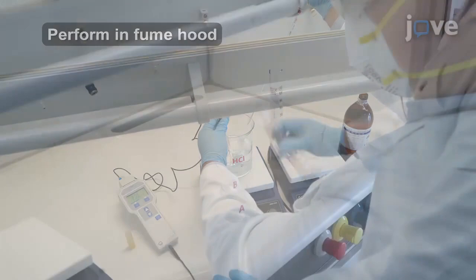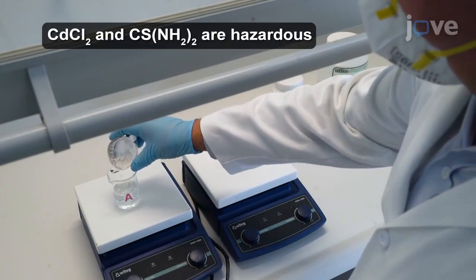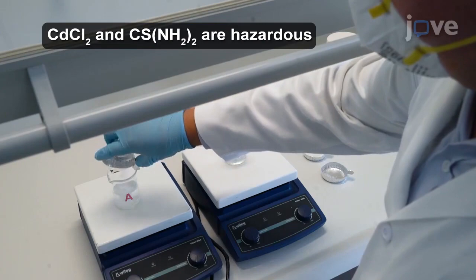Next, pour 50 ml of the precursor solution into two 100 ml beakers labeled A and B. Add 2.29 g of cadmium chloride and 1.33 g of thiourea in each beaker.